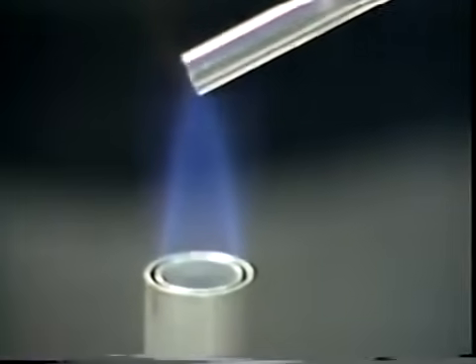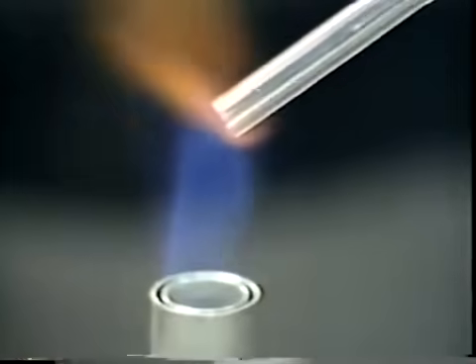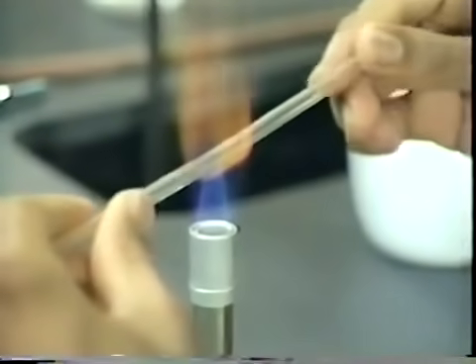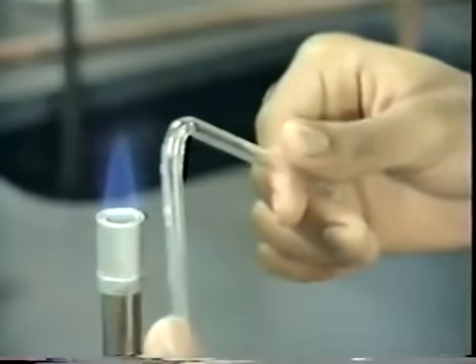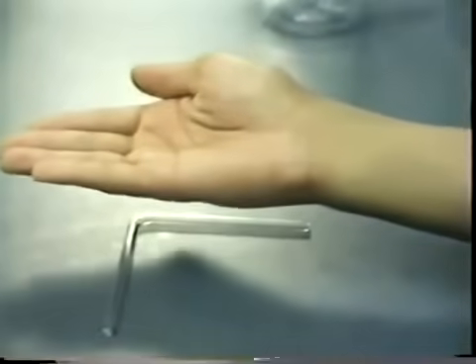I fire polished the rough ends. Then I heated the bent spot with the tip of the flame and bent it away from me. Then I set it down to cool. How do you know when it's cool? Well, you can't tell by looking at it. A good way to tell is to bring the back of the hand down just above it.